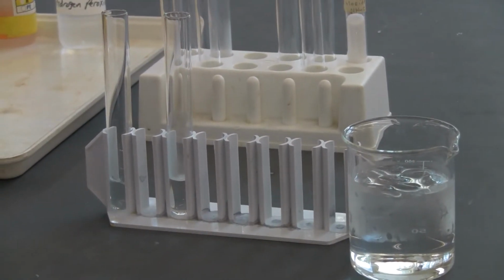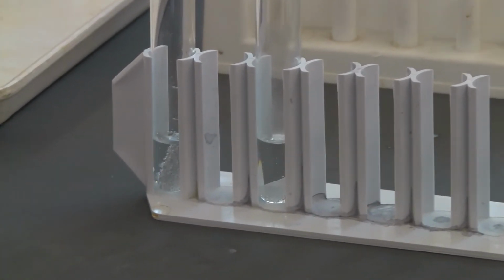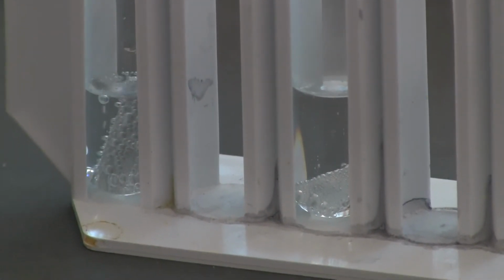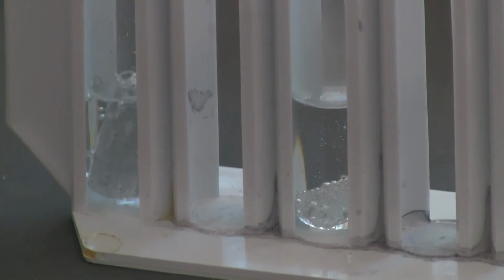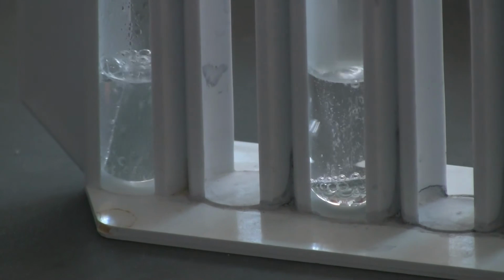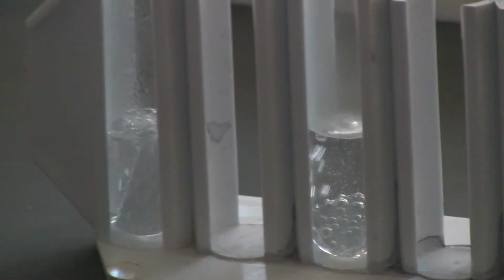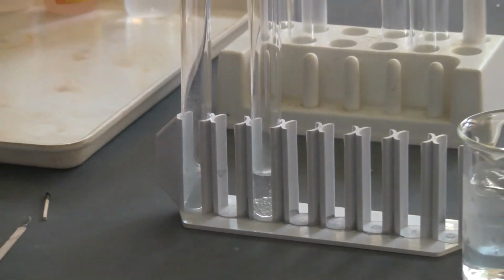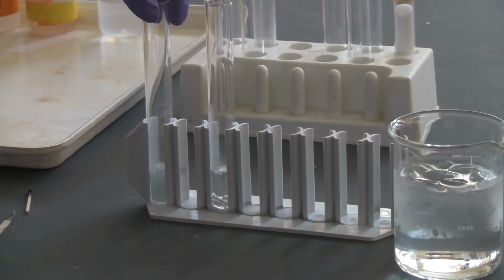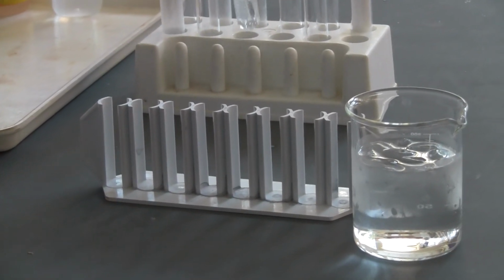Now I'm going to put zinc metal in each. You can see the reaction difference, same concentration this time. You can see one is faster than the other, right? Remember, this is the room temperature, 6 molar, and this is the ice cold, 6 molar. So we see the temperature difference. Now you're going to do the same thing, answering those questions by pausing the video. I'm going to take those away. If you want to take a nice look, you see the difference? Very obvious difference.